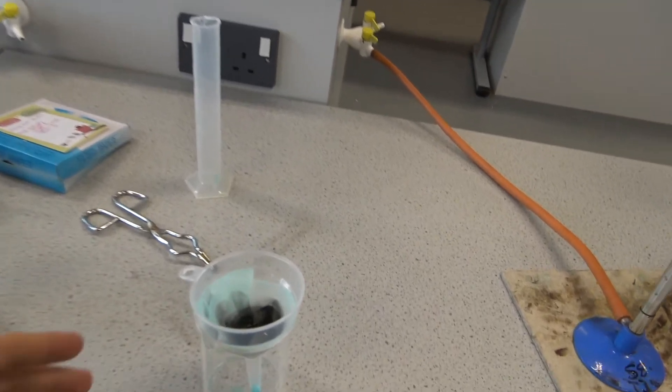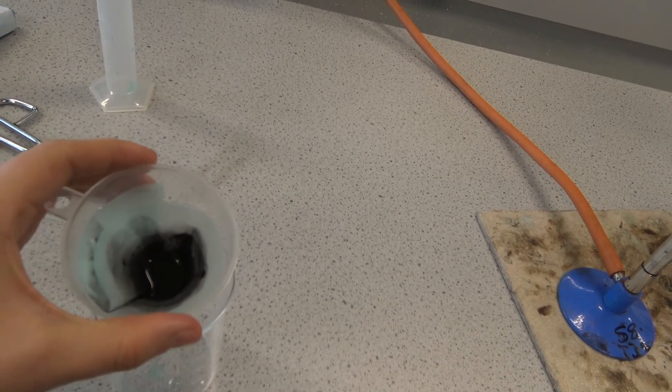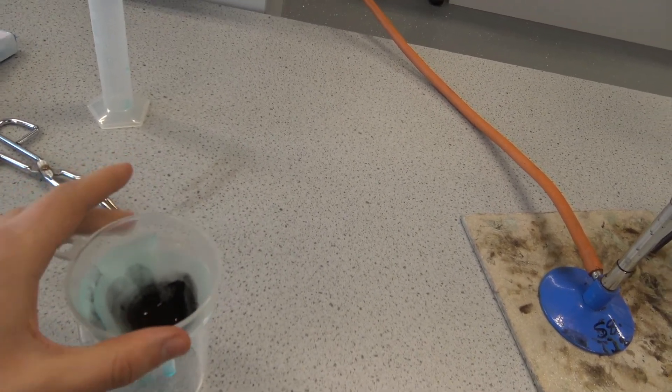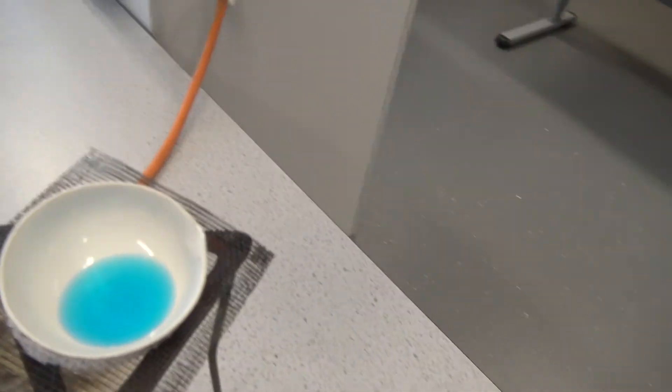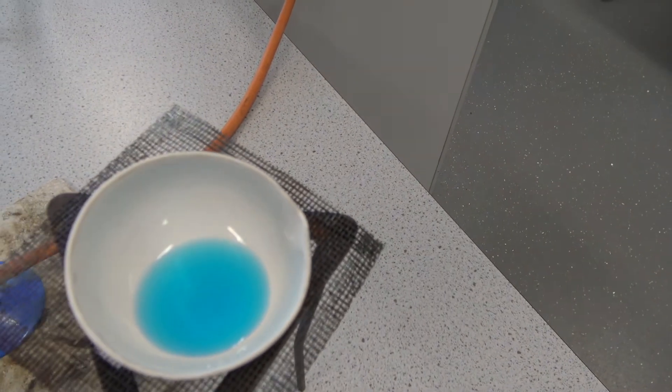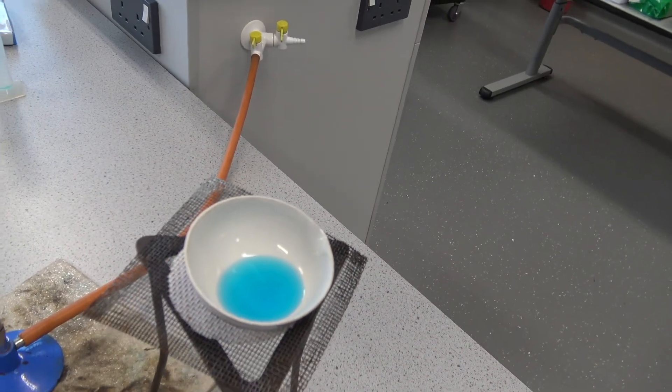Once you have filtered, you're left with the residue and this can just be thrown away. That's just copper oxide that hasn't reacted. I've actually transferred the liquid that's come out into what's called an evaporating basin.